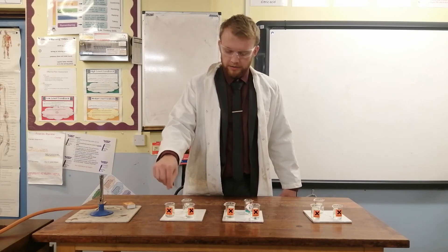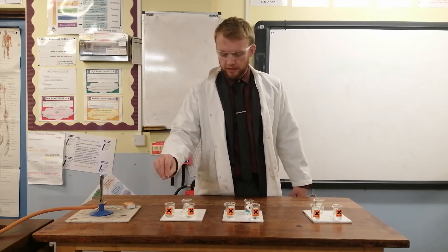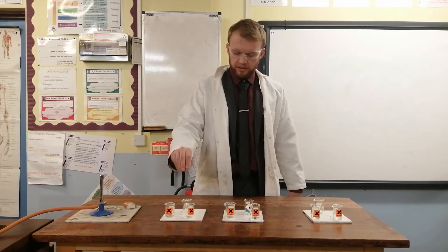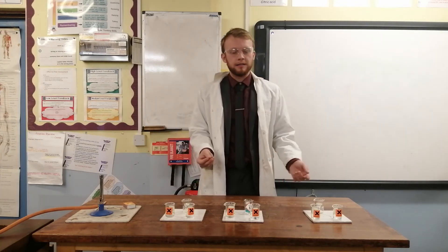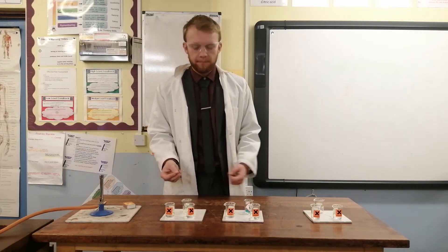It's really important that when you've finished you make sure you properly clean the wire so there's no residue on it and it's ready for the next person. It's also important that you don't cross-contaminate, so you don't dip your wire into one sample and then the other. Otherwise you'll just get a confusing array of colours and you won't be able to determine which metal ion you have. In fact, this technique only works if you have just one metal ion in your sample each time.